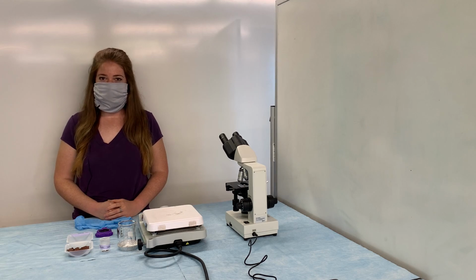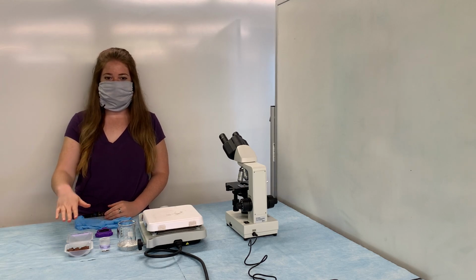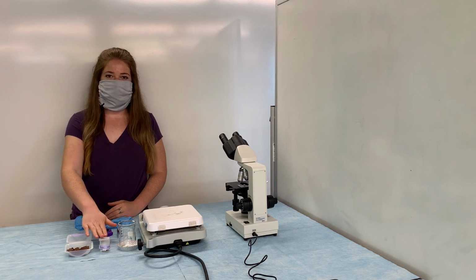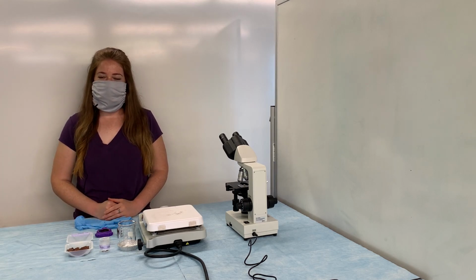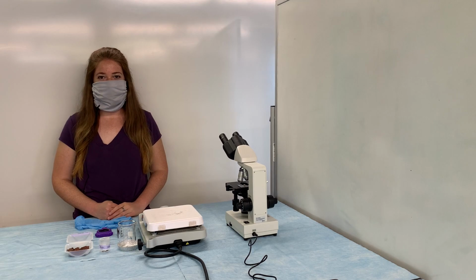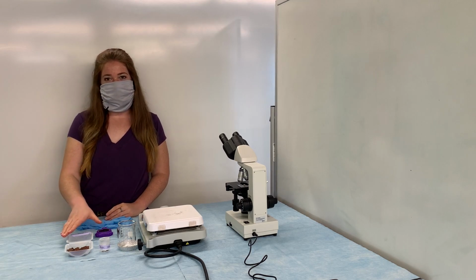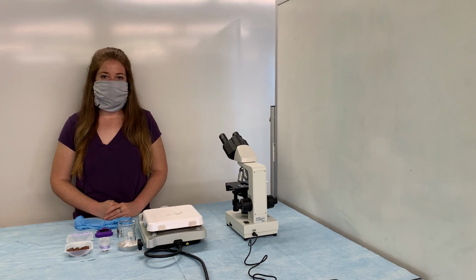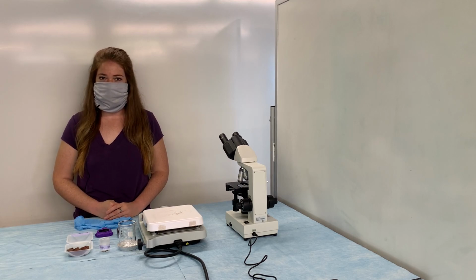So first we're going to combine several lava rocks together with 10 milliliters of acidic saline solution, which I've already measured out here. We're going to put that in a beaker and heat it on the hot plate until it reaches a boil. Once it comes to a boil, then I'll be adding 3 grams of our amino acid mixture. Remember, we're using these components because they're very similar to the components used by Sidney Fox for his original experiment.